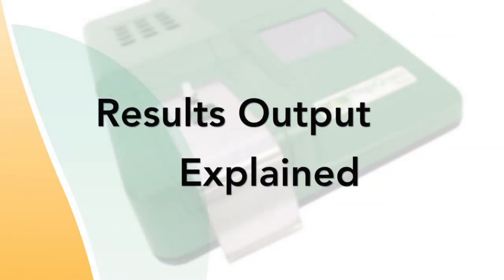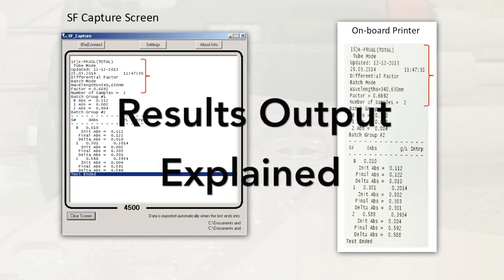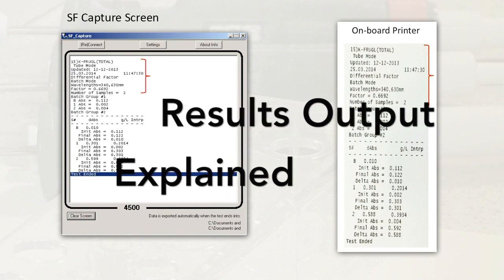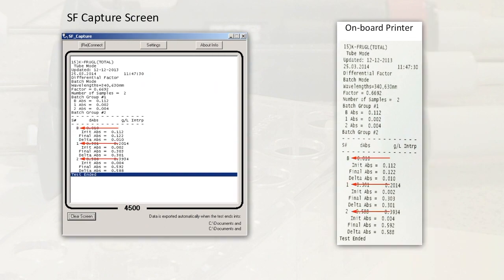When performing any of the Megazyme tests using the pre-installed protocols, the results are exported either via the onboard printer or the SFCapture software. Here is an example of results exported using the SFCapture software. The heading shows the details of the test that was performed. Underneath are results for the individual samples. B is the blank, followed by the number of each sample.